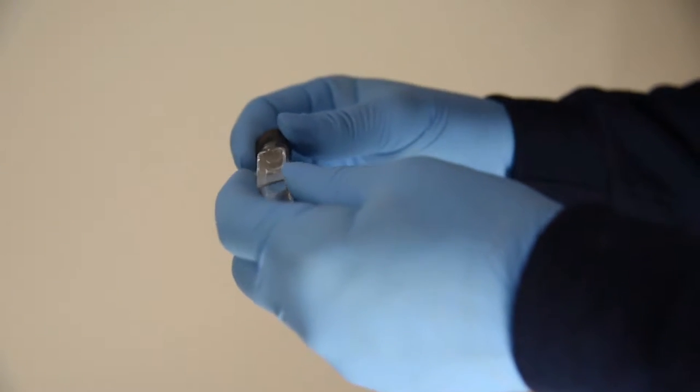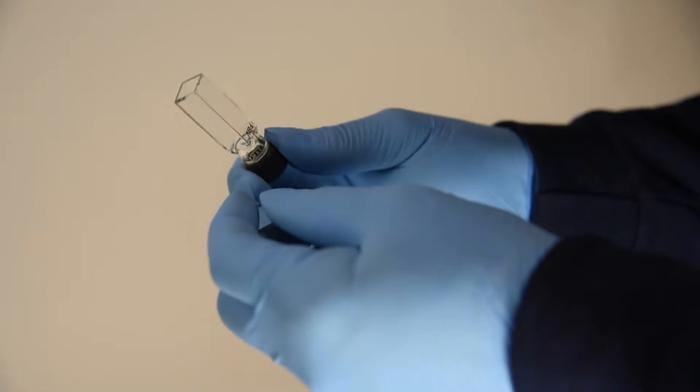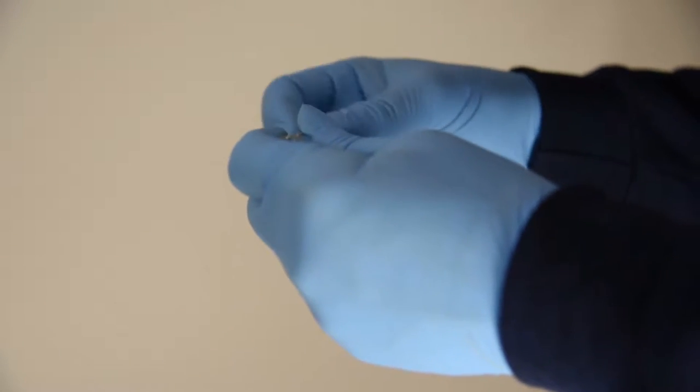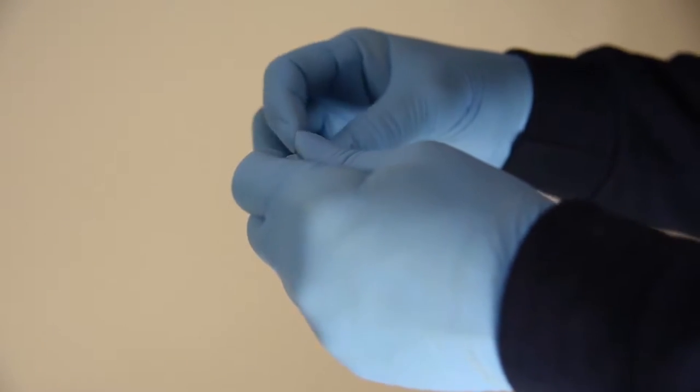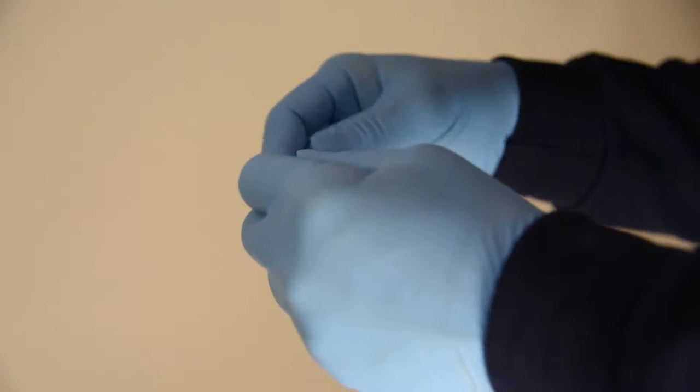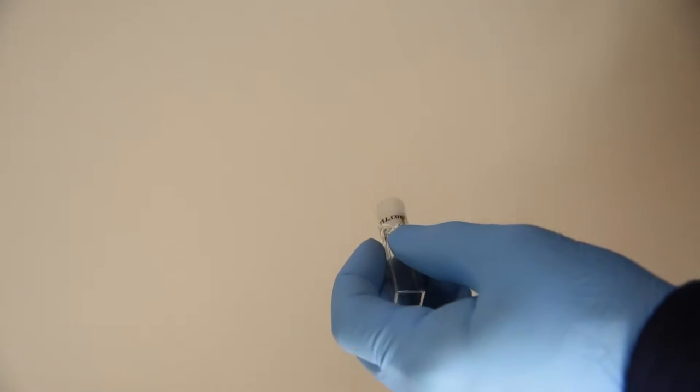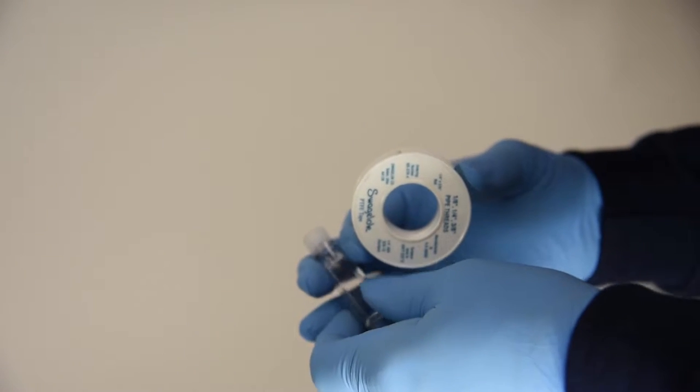Alright, so now what we want to do is, if you're going to use it for a liquid sample, what we recommend, what works best for this application is to use some teflon tape on your thread.